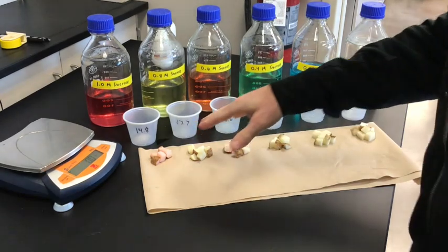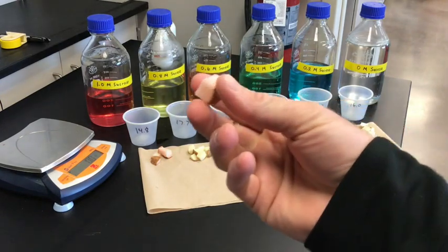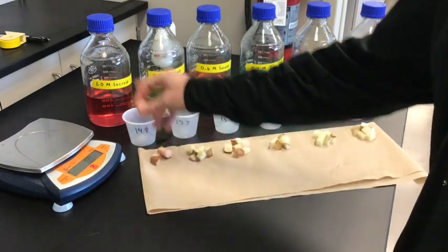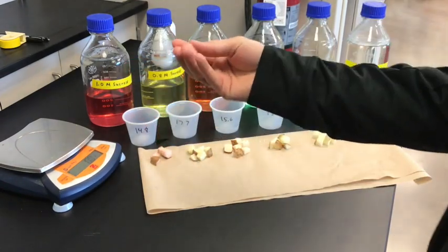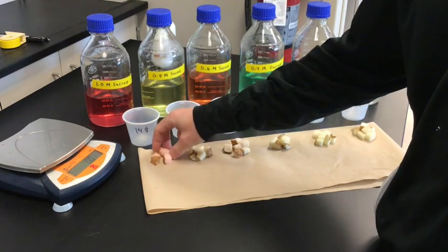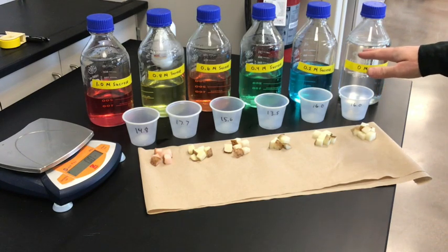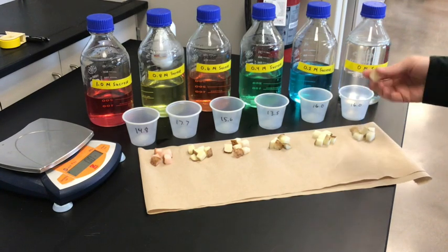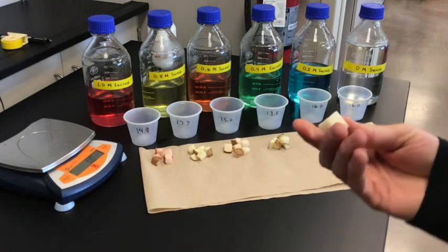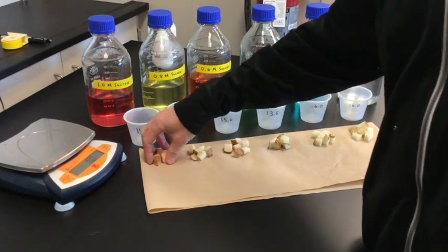I've got the potato chunks ready to be weighed. A qualitative observation is that the chunks in the 1.0 molar sucrose solution feel dehydrated — they've lost water and mass. The ones in the watery solution, the 0 molar sucrose which is pure water, feel crisper and fuller. So let's go and get the quantitative observations — the numbered measurements.